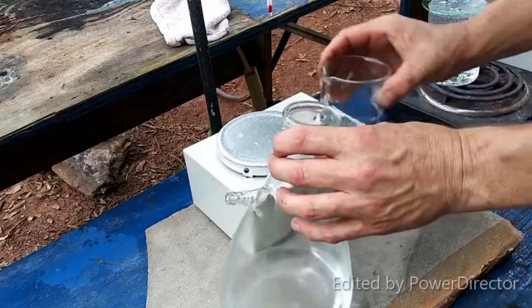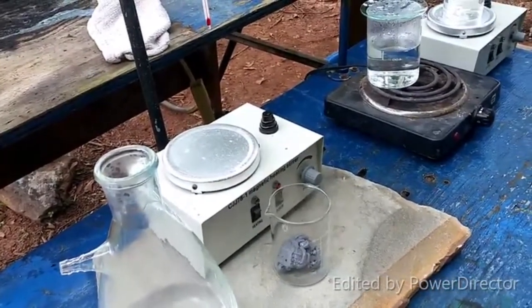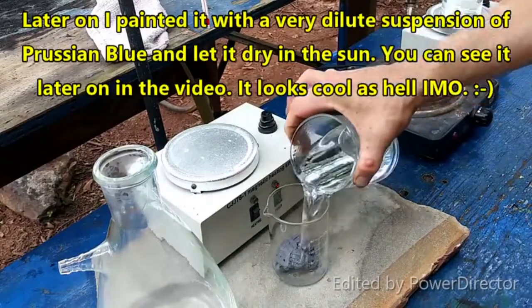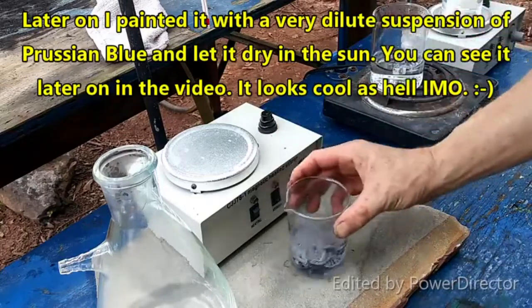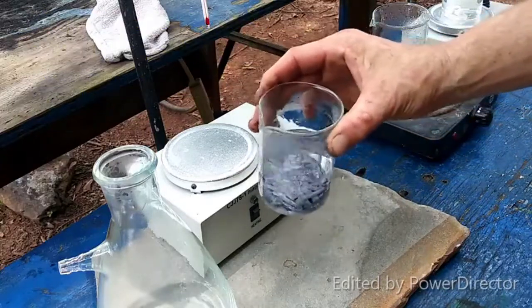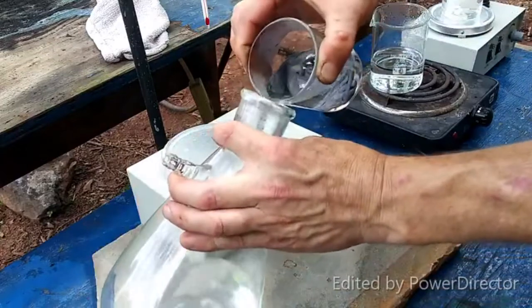It says not to disturb this too much. Do you guys like my new stone slab? My roommate got that the other day. The textbook was very particular about not compacting the lead sponge, so we want to be gentle with it.